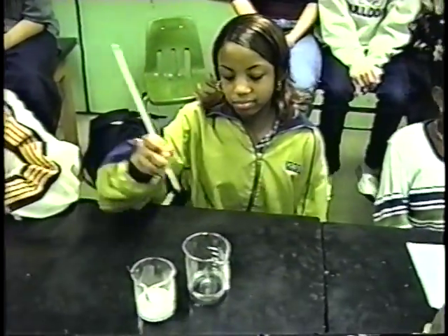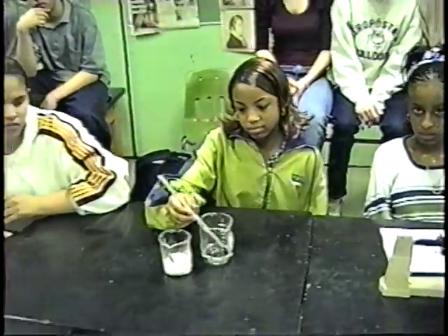Now I want you to put the thermometer into the water, and you're going to be taking a temperature in degrees Celsius that is called TI. What does TI stand for? Initial temperature. And what does the word initial mean? What is it referring to here, if it was a vocabulary word? Initial. First, beginning. Yes, what you're initiating it at.